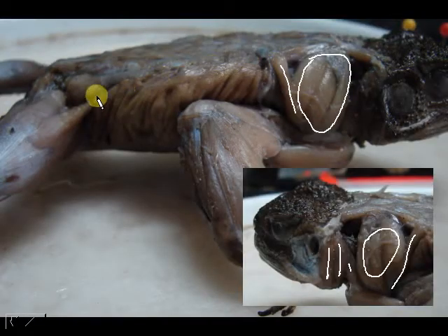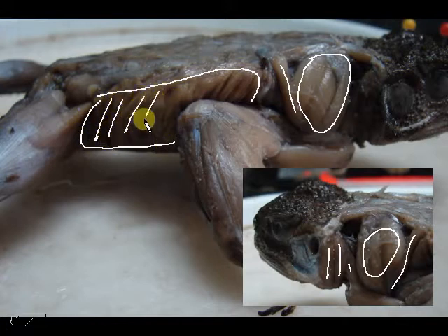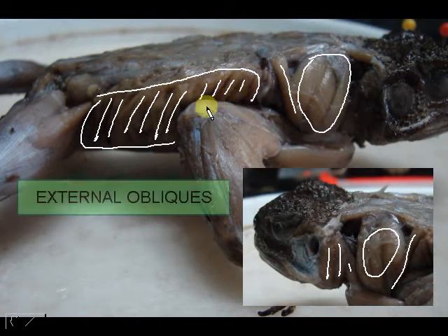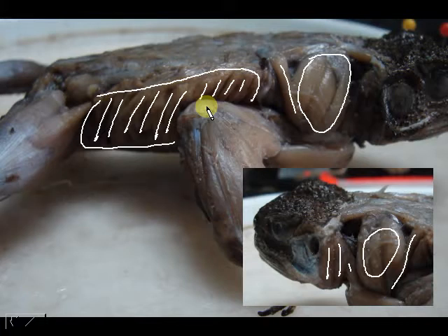Then we will add this one, this entire part right here. As you can see, the muscles run obliquely, and they are found at the outermost, externally, which is why the name is the external obliques. Quite simple. Now let us move on.